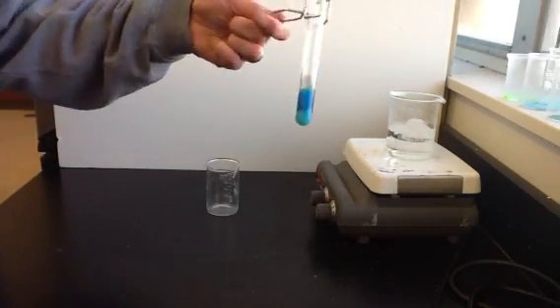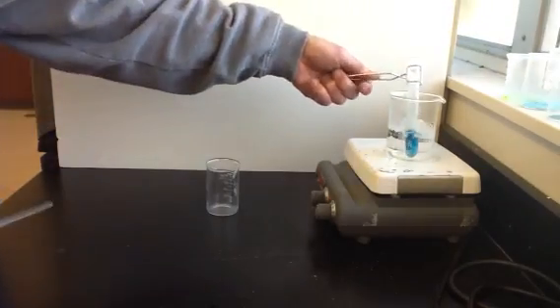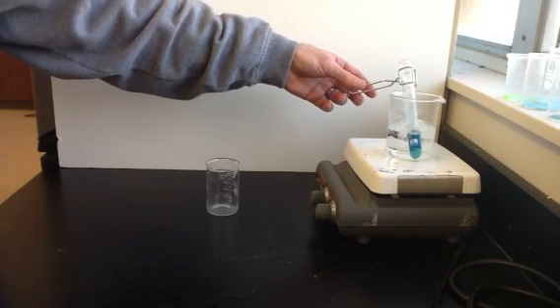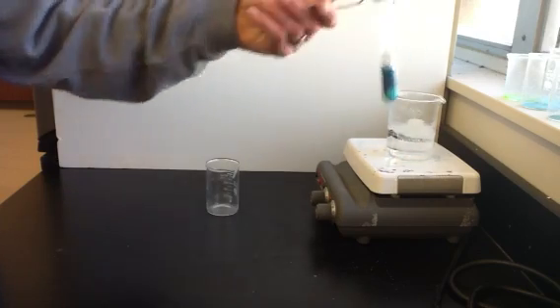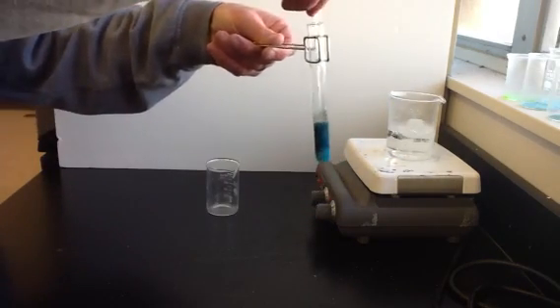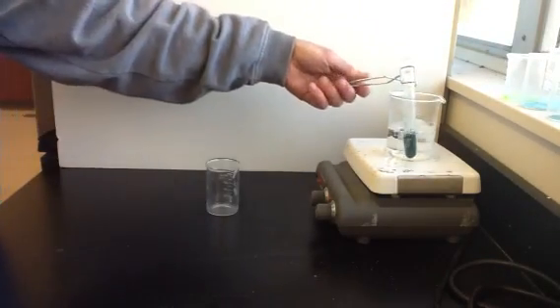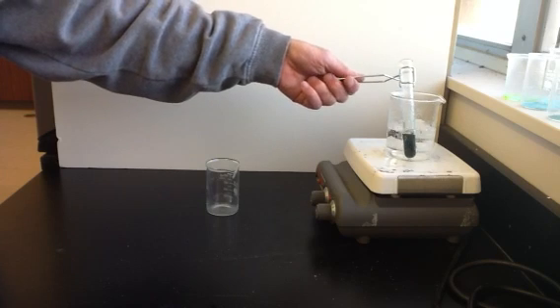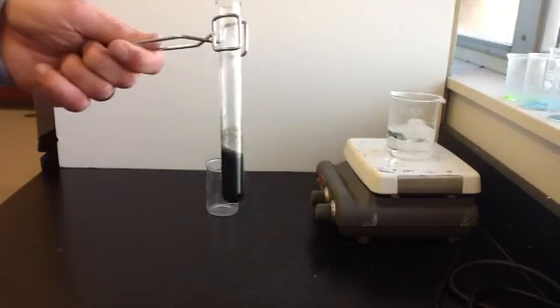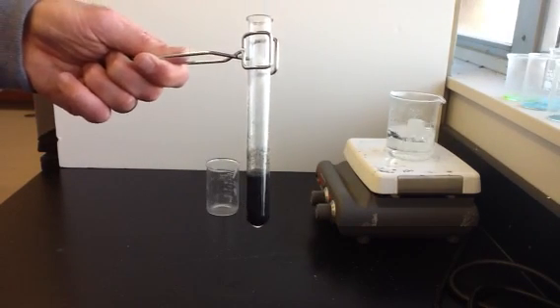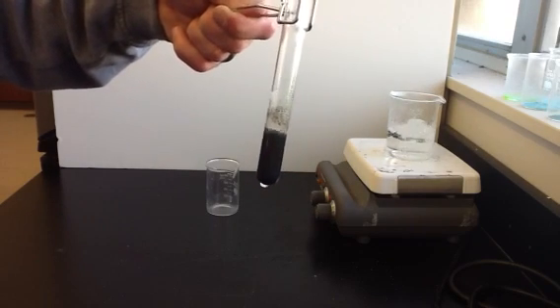We can see a little color change is starting to occur. I'm going to stir it around a little bit and then continue to heat it. And we can see a color change. It's getting darker. Stir it around a bit more and heat it a little bit more. And now it looks like most of the copper hydroxide has turned into copper oxide. And now it has a distinctly different color. It's turned black. So it was that bright blue color when it was copper hydroxide and now it's copper oxide, which is this dark black color.